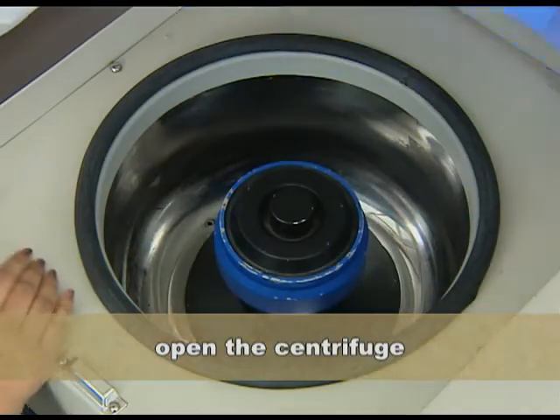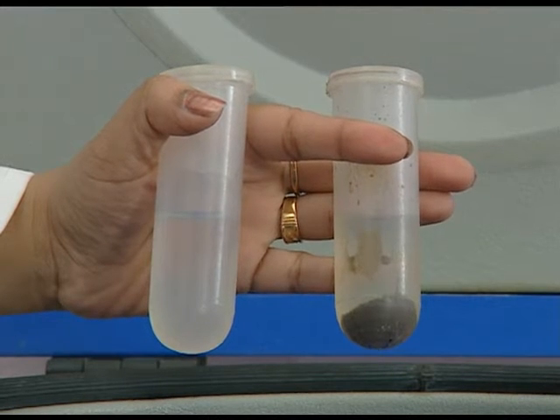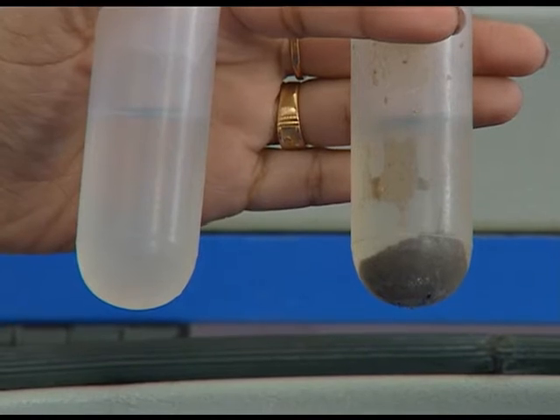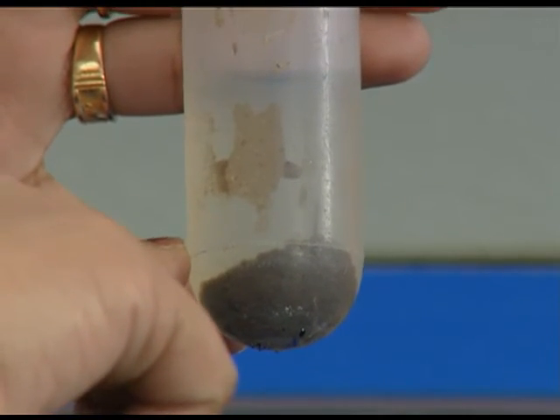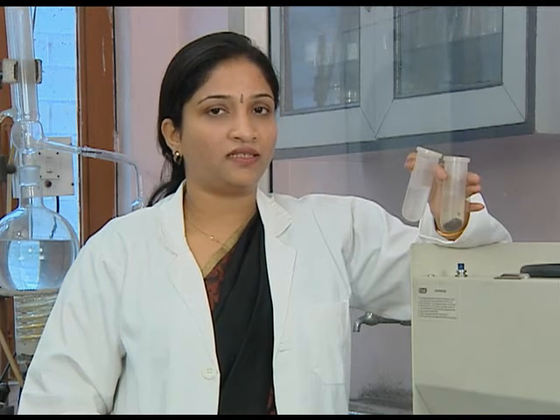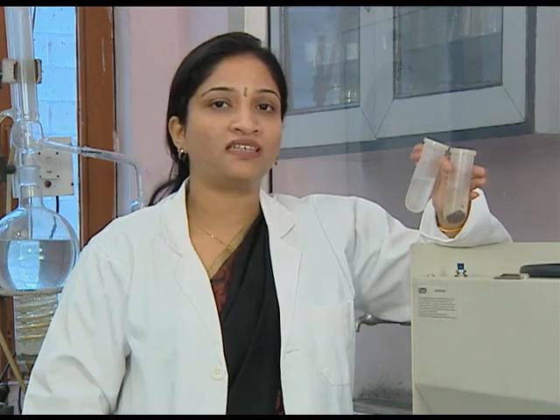Let's open the centrifuge and observe the samples. You can very clearly see that the solid particles — the denser particles — have settled down, and there is a clear solution in the centrifuge tube. The particles that settle down form the pellet. The remaining clear solution is known as the supernatant. So when a cell homogenate undergoes centrifugation, it gets separated into two components: the pellet and the supernatant. The more dense particles settle due to their higher molecular weight or density and form the pellet.